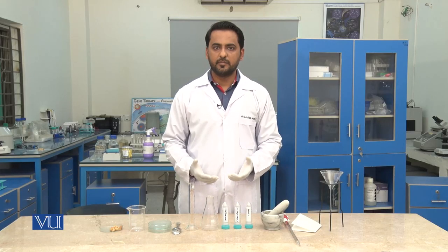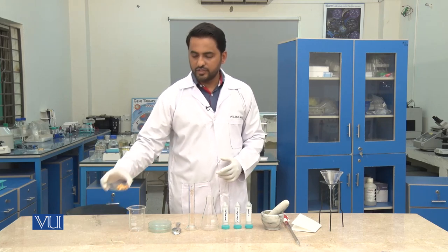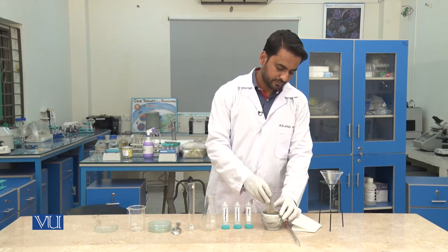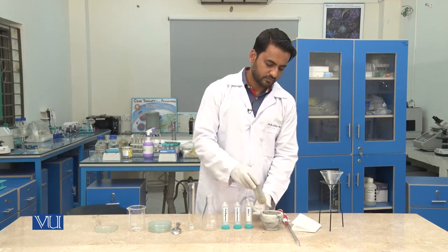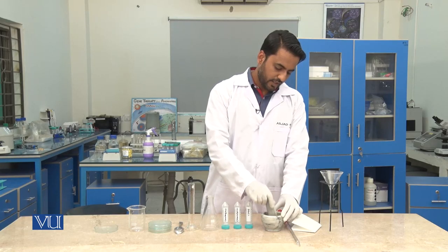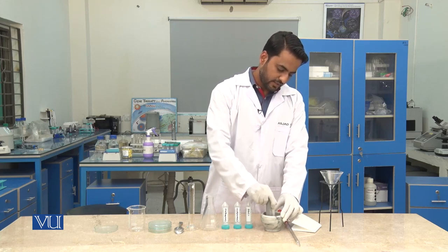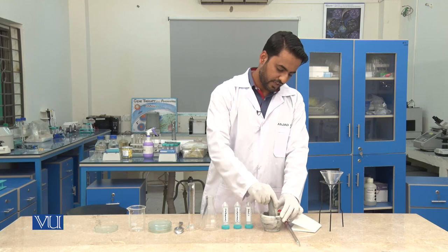Let's begin with the experiment. In the very first step, we will take cashew nuts and with the help of a pestle and mortar, we will grind them well. Keep in mind that the cashew nuts should be ground very well. Once they are ground, we will transfer the powder form of these nuts into a 250 ml flask.